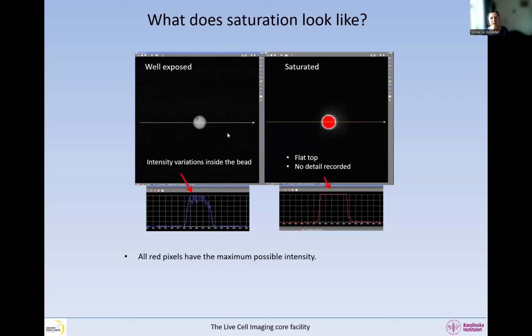So we see the little structure. And if we do a histogram where we plot an intensity profile, where we draw a line like this and we can see the intensities along the line, what we can see at the top here, where the line is across the bead, is all sorts of intensity going up and down. Whereas if we saturate the bead, this is what it looks like, and what happens is the top is flat. There are no details at all recorded in these areas. So all the red pixels have the maximum possible intensity. It's not possible for the sensor to record higher intensities than that. So the intensity information recorded for the saturated pixels is incorrect. Okay, it is absolutely incorrect.